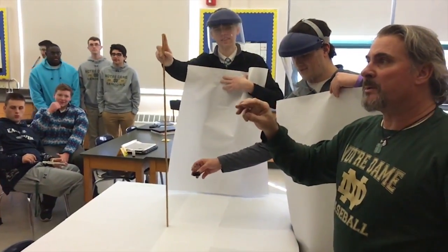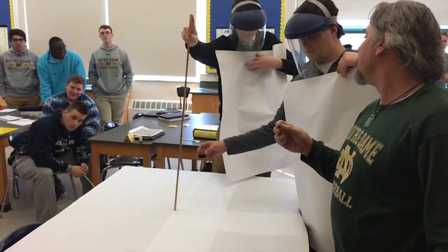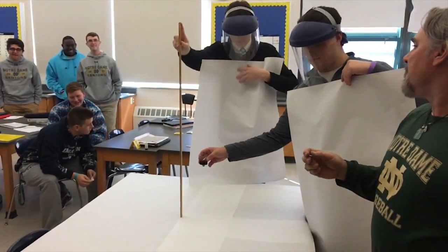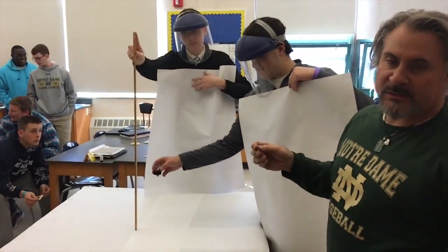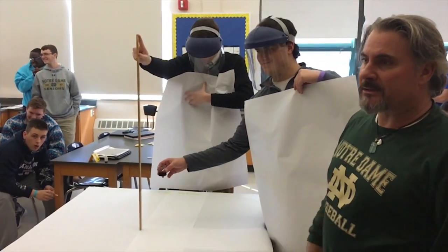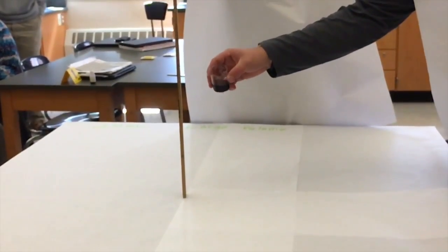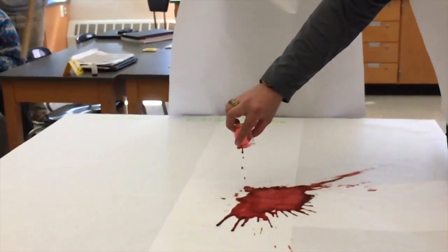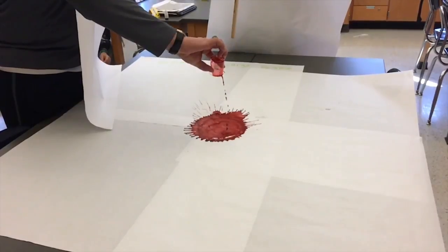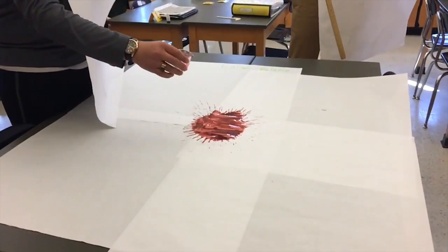This is blood spatter analysis. What we're doing today is dropping blood — this is a large volume drop, so we're dropping 20 milliliters of blood from 30 centimeters. We're going to see how the increase in the volume of the blood affects the pattern it creates in the spines of the drops and the satellite drops.